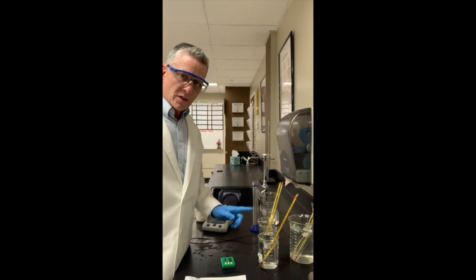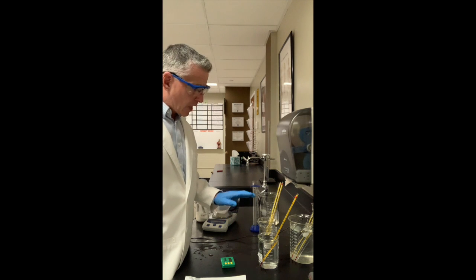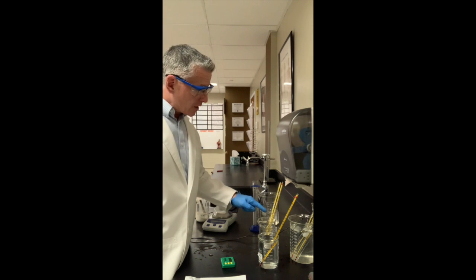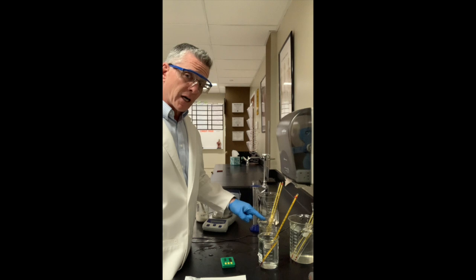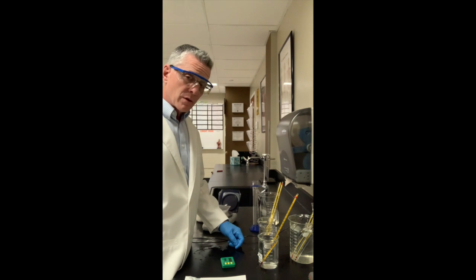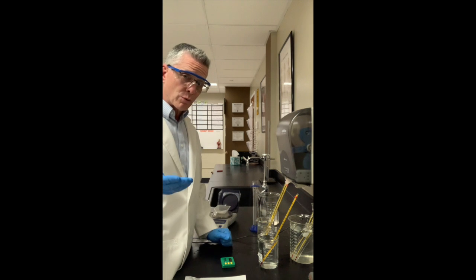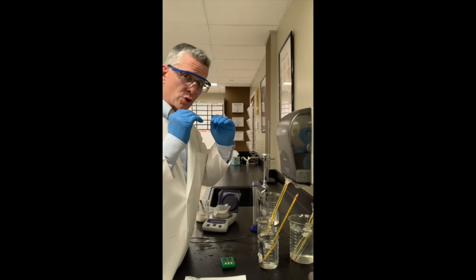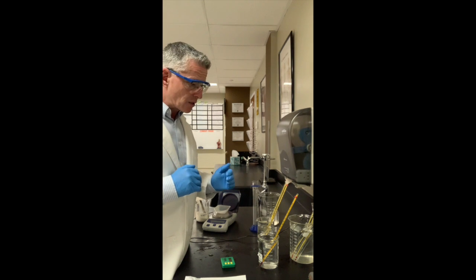So I'm done recording the temperature on the first one. The lowest temperature that I got to was 6. I couldn't go any lower. The temperature of the faux Ana, that is the diaper gel in the solution, gave heat off to the environment, which happened to be the water bath. Remember, it started at 3. It actually rose up to 6 degrees. The two hit a plateau where they were at equilibrium at 6 degrees.